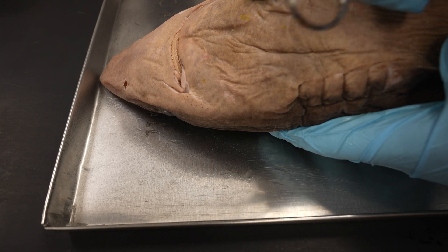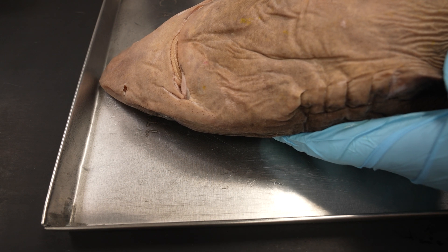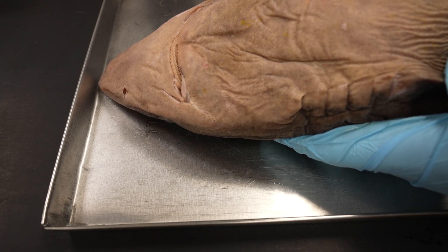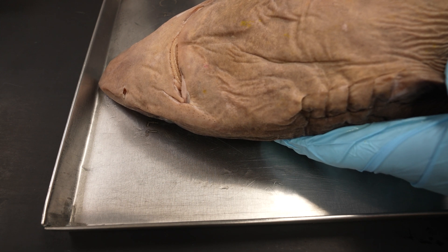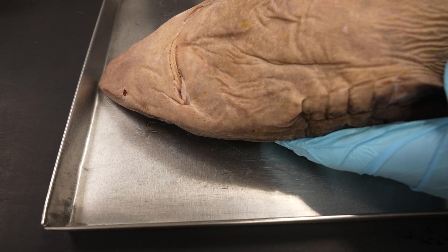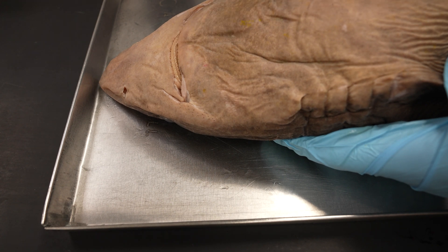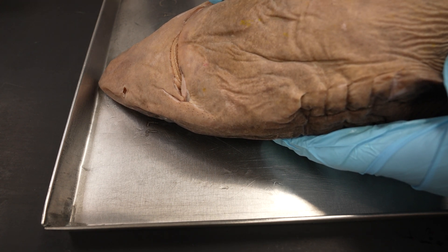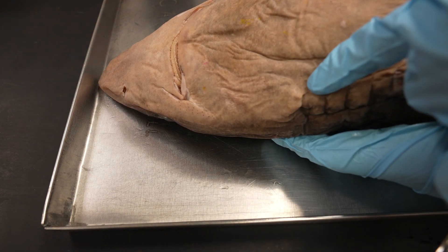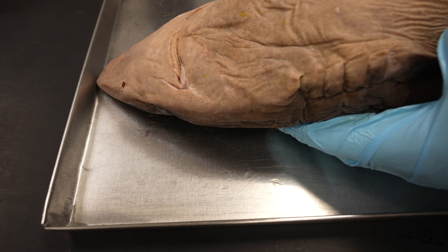So that's kind of cool. That skin is very, very thin, so we want to get underneath it. I'm actually very lucky in that this particular one had a cut — I don't know exactly how it occurred, it probably occurred post-preservation. So I'll start here, make a pocket, cut and expand that pocket, taking it up to about the corner of the mouth and across and down to the first gill slit.